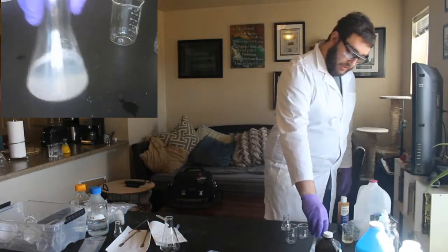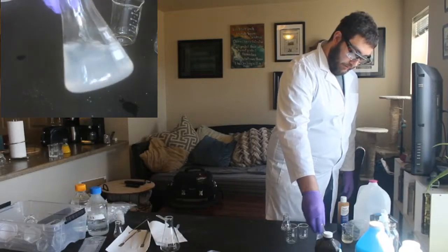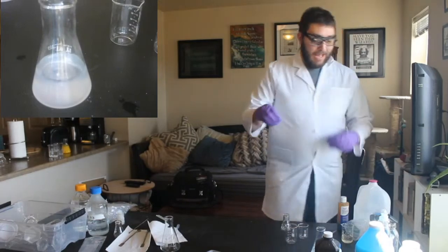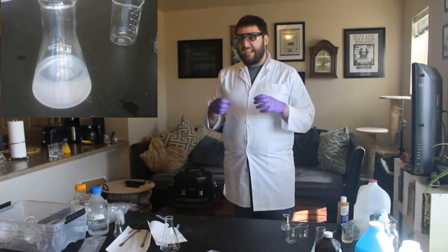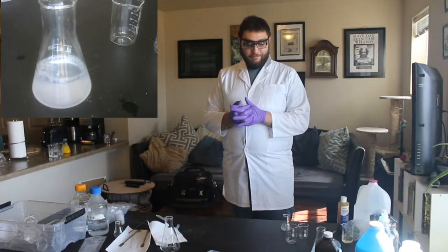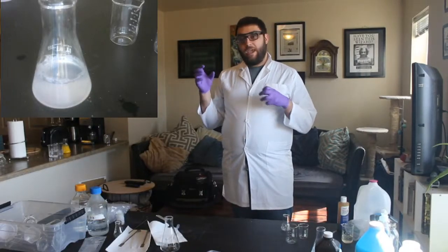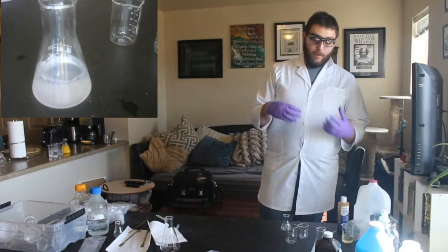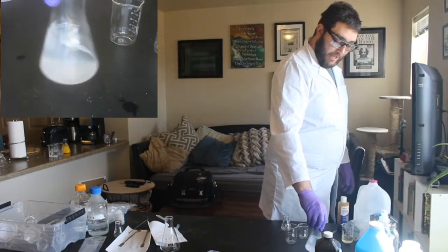So you can see there's nothing happening, right? It's still clear. But if we give it enough time, right now that hydrogen peroxide is eating away at that vitamin C, and it has to eat away at a bunch of it before that reaction will happen. So we're just waiting for this reaction to happen.